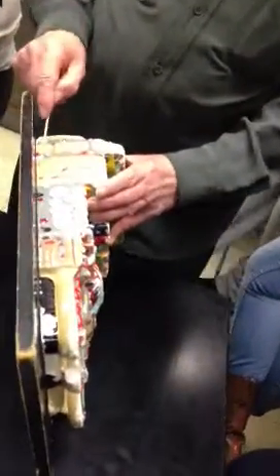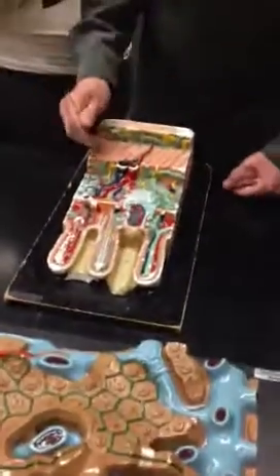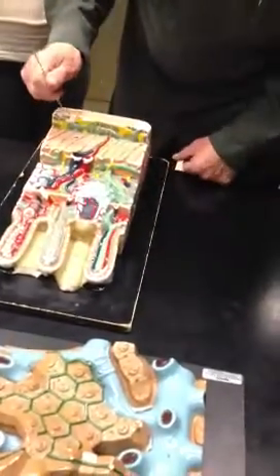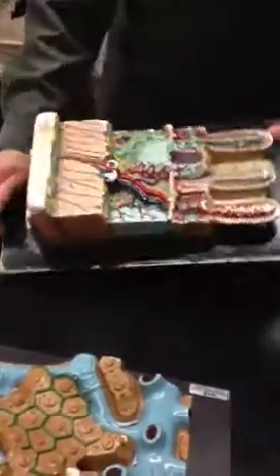Here you can see longitudinal fibers, and here you can see circular fibers. No, I'm sorry, the other way around. Here you see circular fibers, and here longitudinal. Now, the yellow elements that you see. You see some thin yellow elements here, and over here you see these very thick ones. See the thick ones and the thin ones.